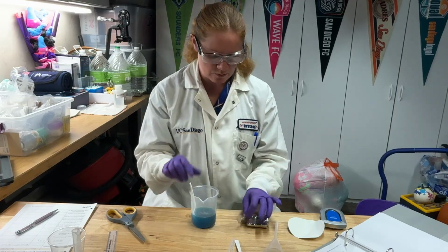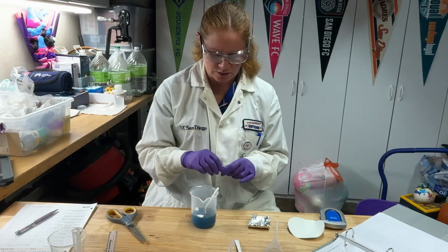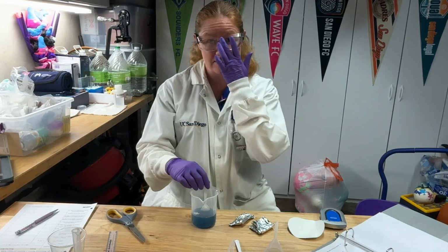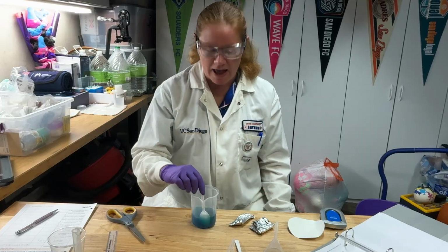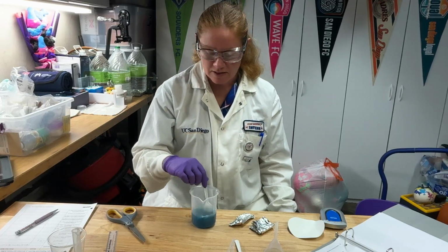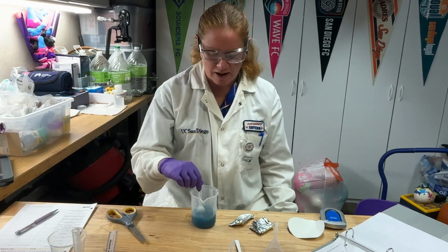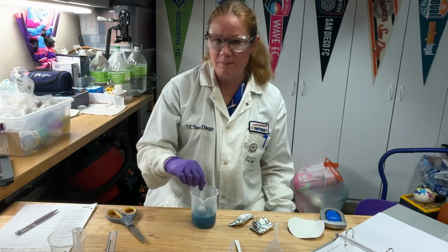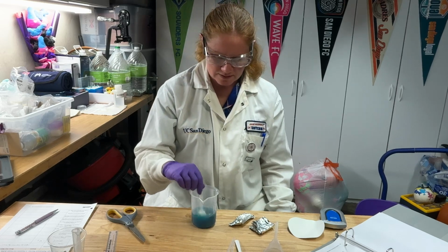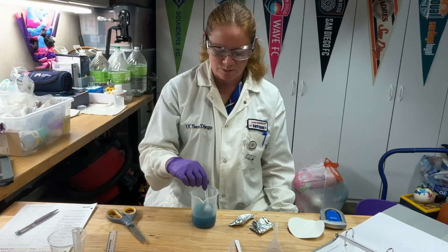Here, I'll add a little bit more. Now, if you add too much aluminum foil, with the hydrochloric acid that's in your kit, you can try adding a few drops of that, very carefully, 1 drop at a time, to see if you can get the aluminum to redissolve. But if you're careful about how you add your aluminum, that shouldn't be too big of an issue, okay? Because the whole point at the end is you don't want any aluminum left and you just want to weigh your copper.